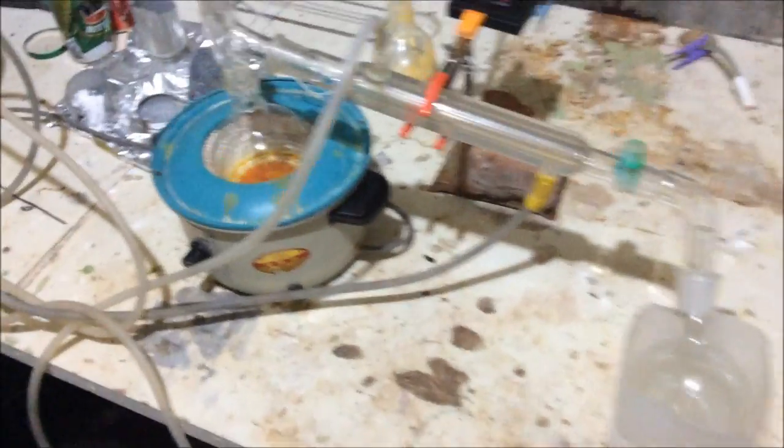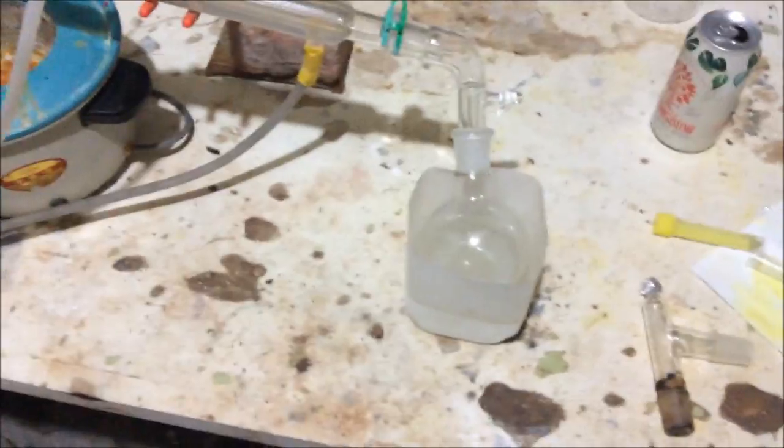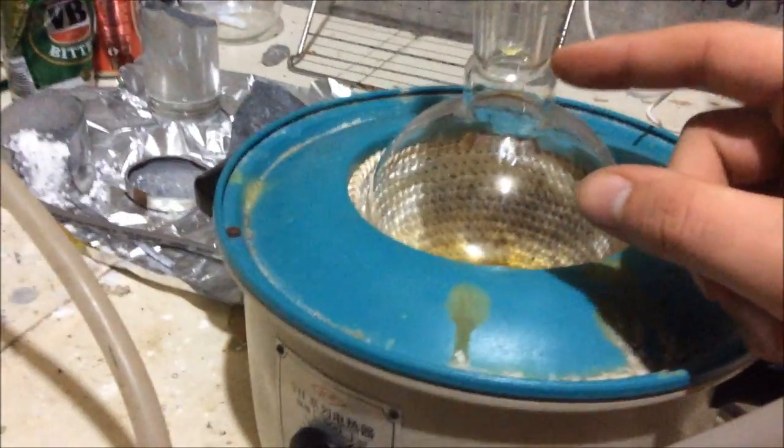This is a very well-behaved distillation, which is nice — it reminds you how distillation is meant to work. We've got basically all of it out. More importantly, all the red is in the flask and all the clear is in the collection vessel. It's basically all solidified. The temperature is dropping and I've turned the heat off. You can see the condensate has a slight yellow tinge, so I'm stopping now to choose purity over absolute yield. There is our solid block of benzene.